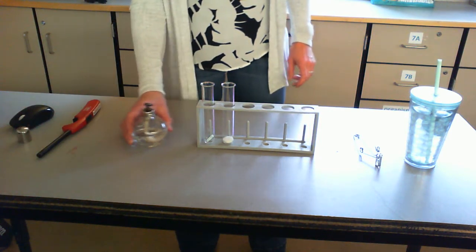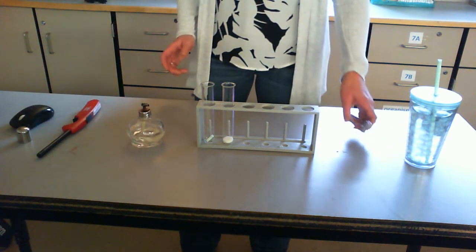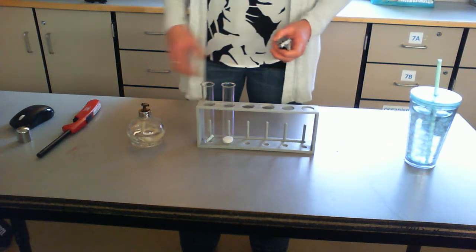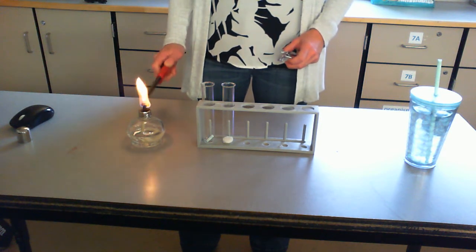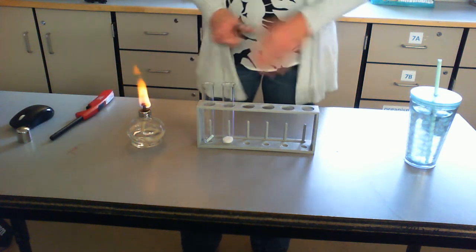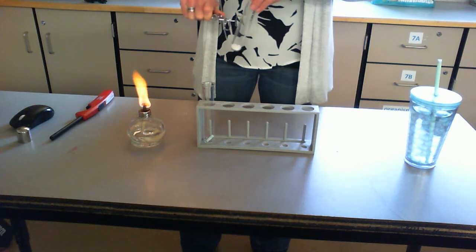I'm going to use an alcohol burner. It's going to create a larger flame compared to a candle. So once again, please don't try this at home because an alcohol burner you probably don't have access to. So I'm going to start with the sugar.